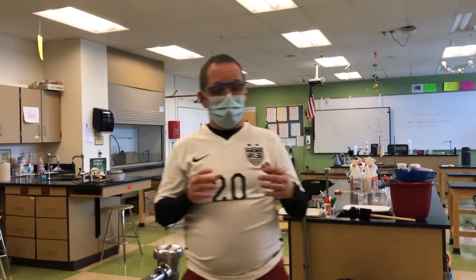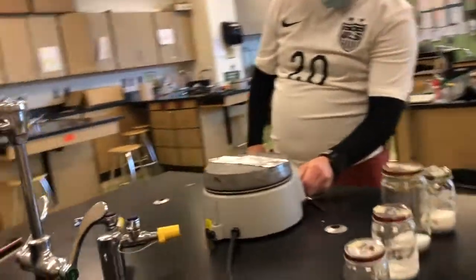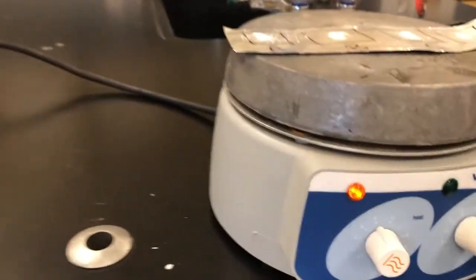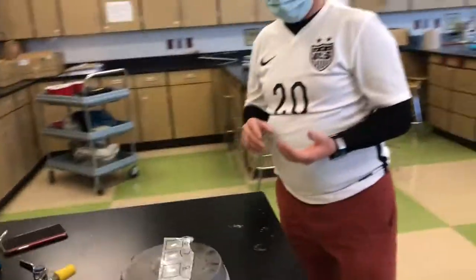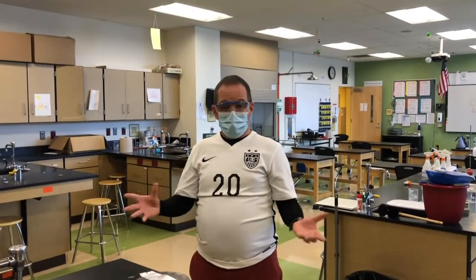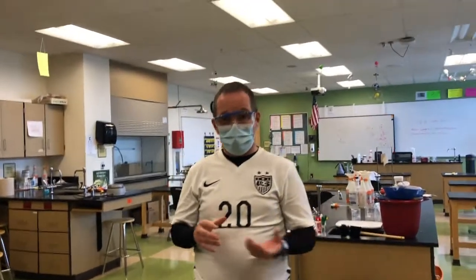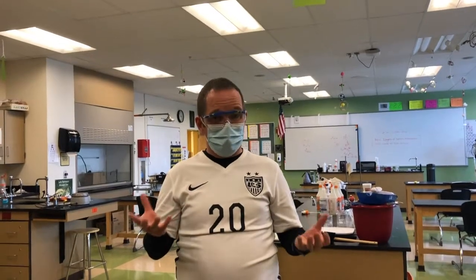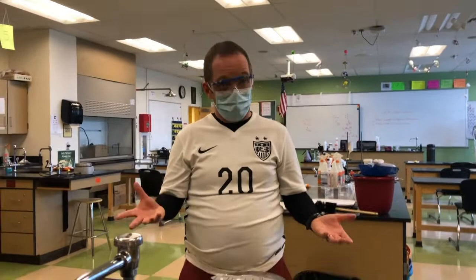That is, we're going to turn on this heat source, this hot plate that we have here, and we're going to turn it on about halfway, which I have done. I'm turning it up to the 5 mark, and we are going to see, as this hot plate heats, which of these substances melts first. So, molecular compounds tend to have very low melting points, and so we would expect them to generally melt first. Ionic compounds tend to have very high melting points because ionic bonds are stronger than the covalent bonds that form molecular compounds.